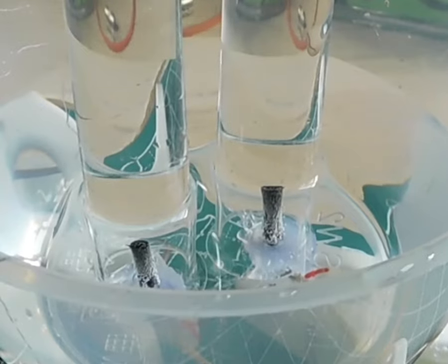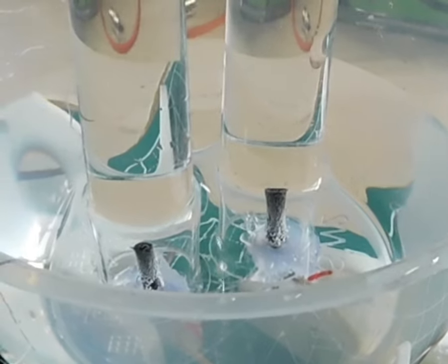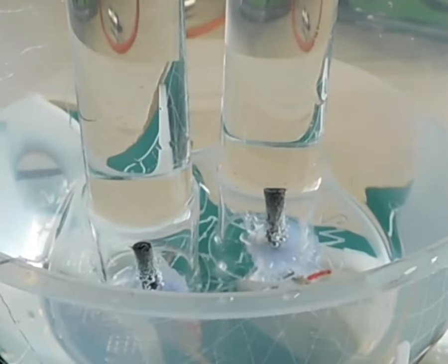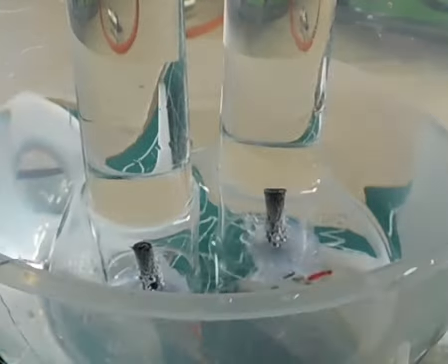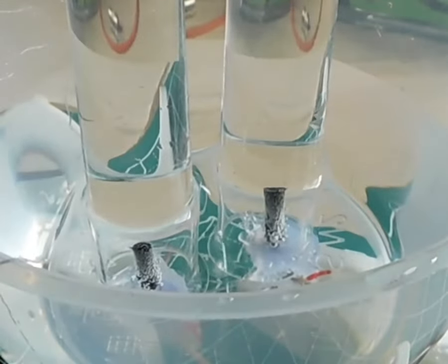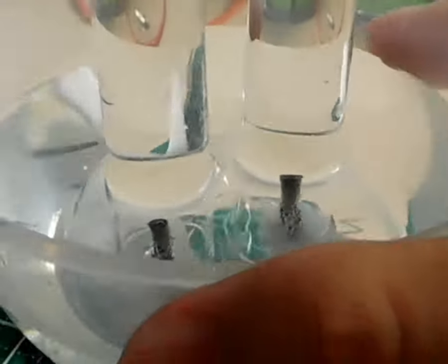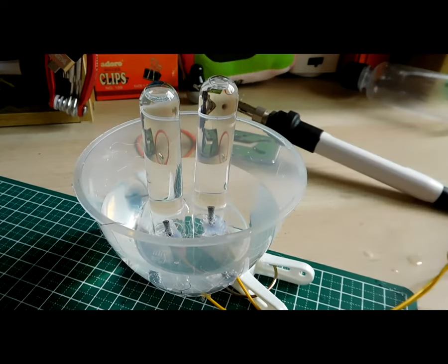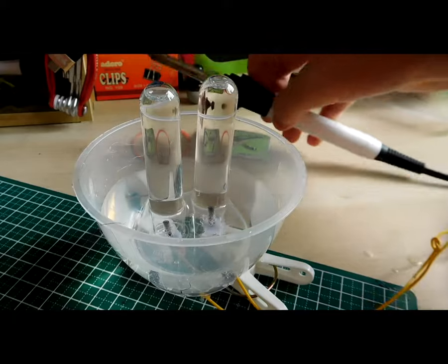If you look carefully, you can see the very tiny bubbles starting to float up to the top of the test tube and occupying the airspace. As this continues on, the volume of the water in the test tube will slowly decrease, and that's the volume of the gas collected.